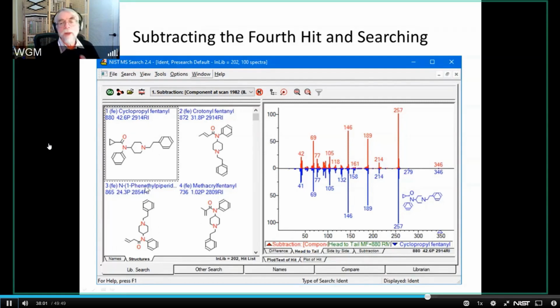And what we have found in doing that is that we still have a problem in that this match factor is high, and this match factor is high, and this match factor is high. So what we know is it's one of these three. We really don't know which one. So we haven't resolved it. And that's often the case. Sometimes you just simply can't resolve it. We will look at least slightly reducing the scope of this.